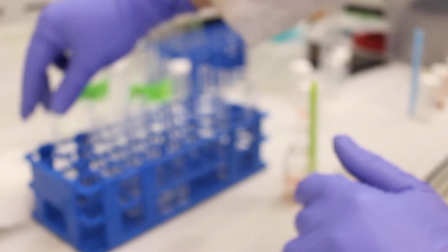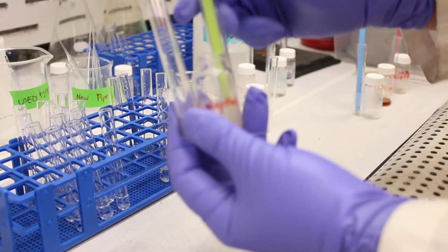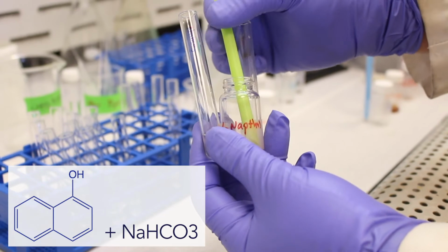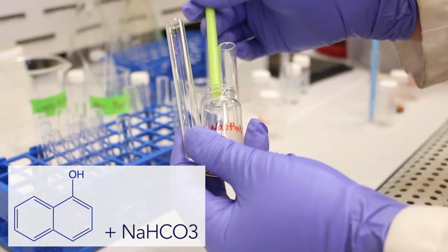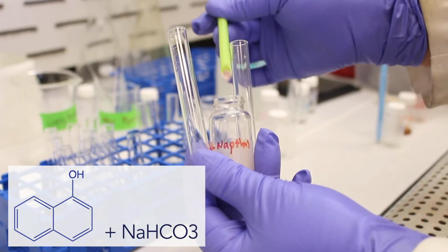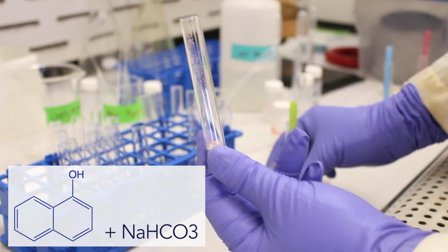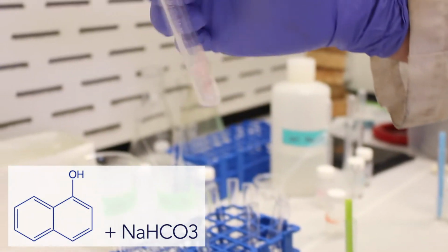Now, interestingly, if you now take the alpha naphthol and you react it with a weaker base like sodium bicarbonate, the sodium bicarbonate is not a strong enough base to deprotonate it. So we would expect it to be insoluble in weak base. Okay.